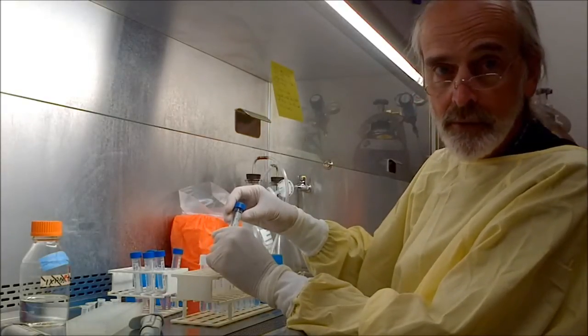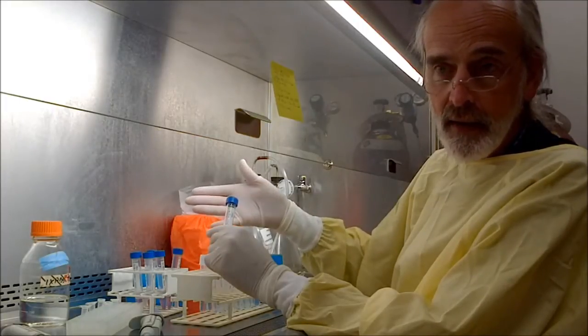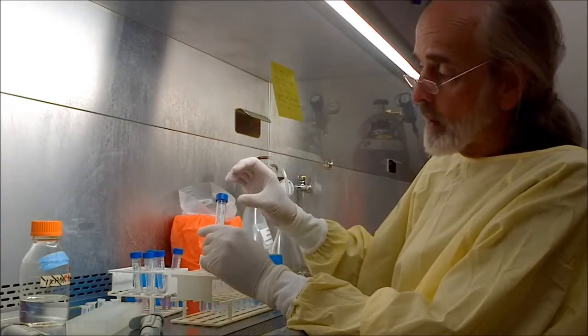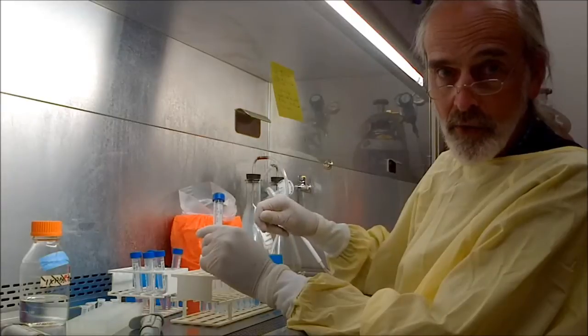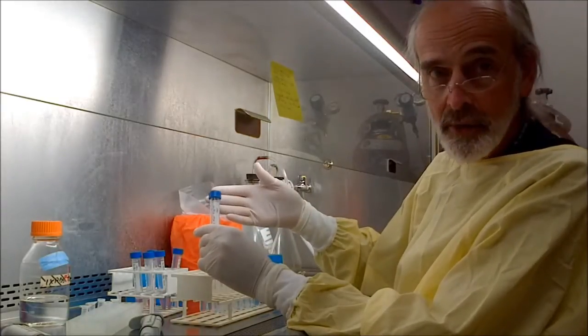And the way I do the dilutions, you can think of as if you take, say, a glass of Coke, and it's got a dark color to it. And you take another glass and you put a little bit of water in it, and you take some Coke out and you put it in the other glass with the water, and now the Coke is diluted, right? Okay, and that's basically all I'm doing.